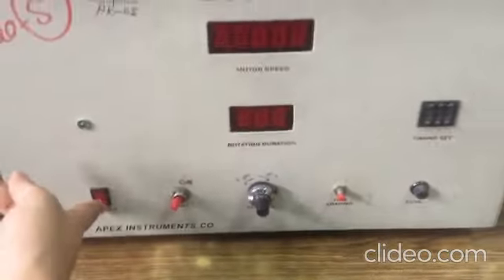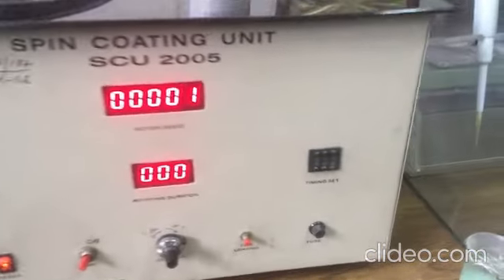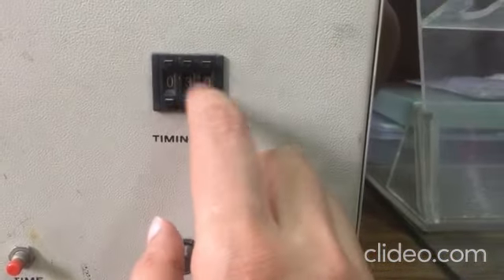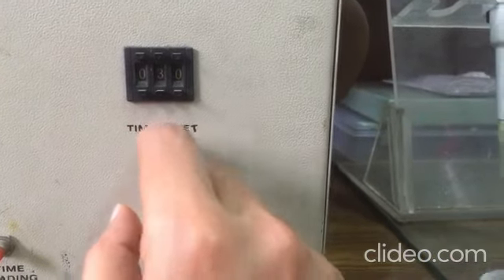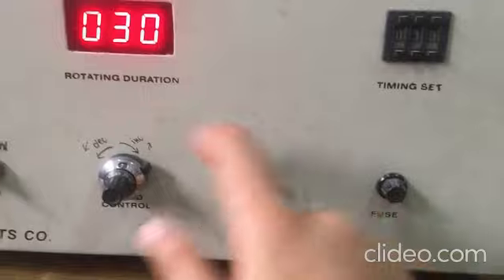We switch on the power button and can load the time in seconds. It can be 30 seconds, 40 seconds - we can change it. You can see in this display it shows 30 seconds.